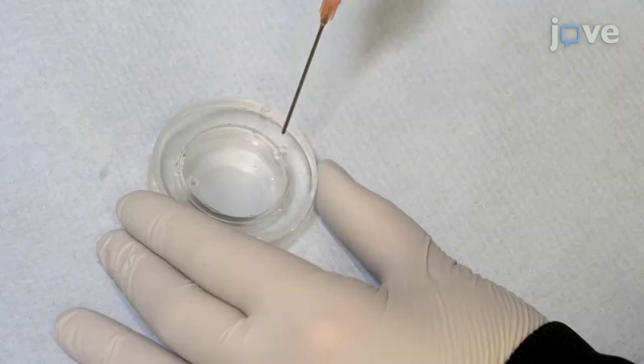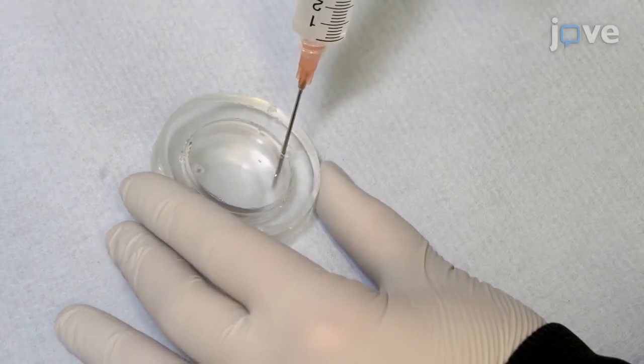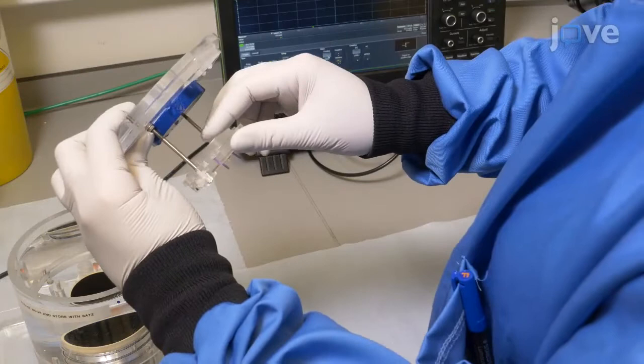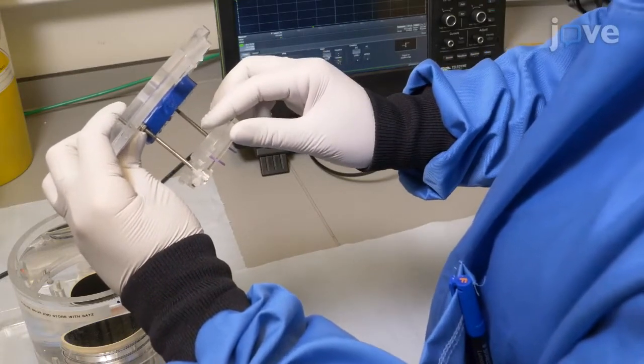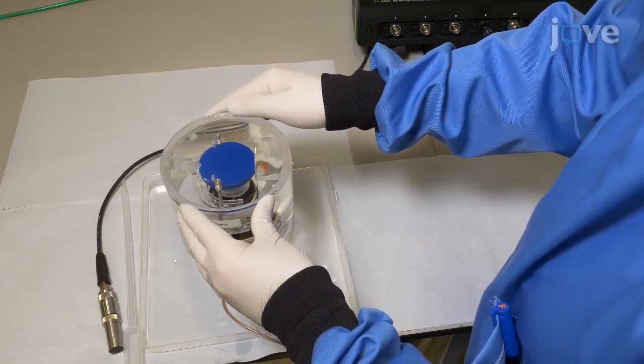These benchtop system design, data collection, and analysis principles can be used as a rational foundation for the in vitro study of cavitation-enhanced therapies. Our techniques enable high-throughput testing while preserving the critical experimental attributes of integral cavitation monitoring, repeatable sample alignment, and compatibility with common cellular analysis methods.